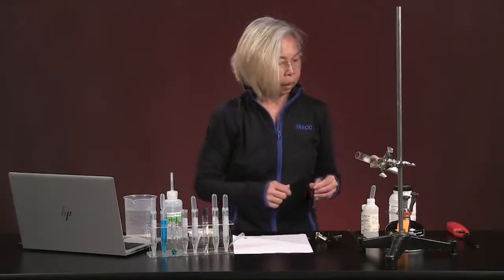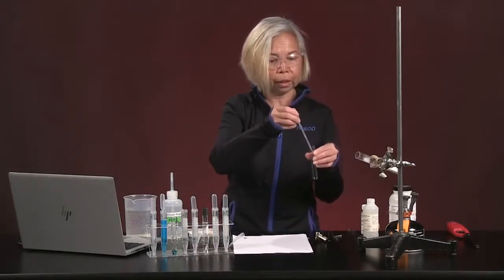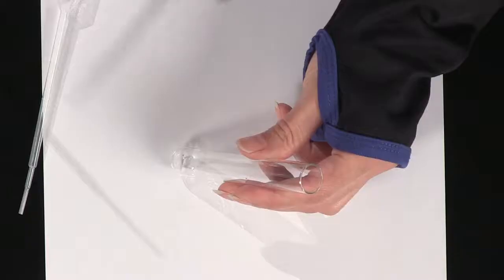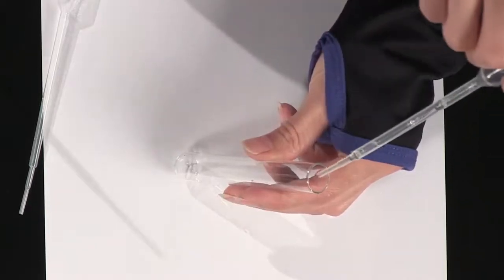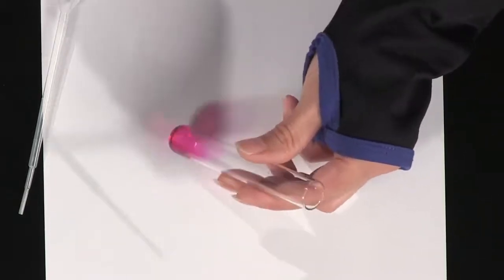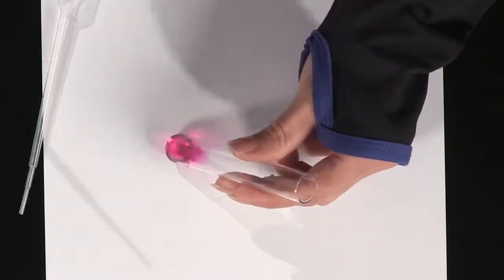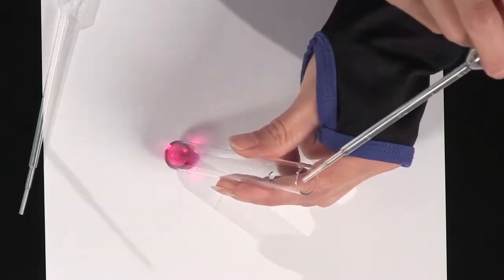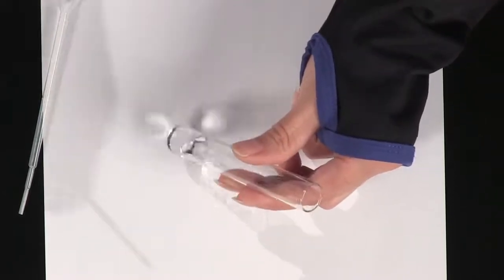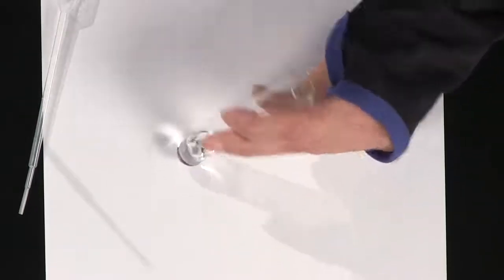And then we're going to be doing a very simple experiment using phenolphthalein. I'm going to add 1 drop of phenolphthalein into this little tube over here. I'm going to be adding 1 milliliter of our base. Does everybody see that beautiful fuchsia color? I'm going to be adding 1 milliliter of acid, hydrochloric acid. Anybody notice any color changes there? Look at that. That is also a sign of a chemical reaction.